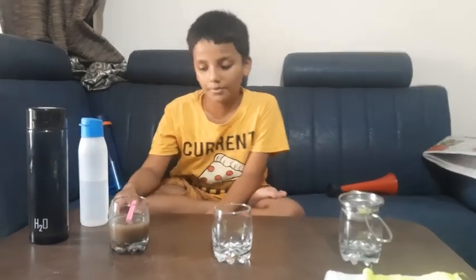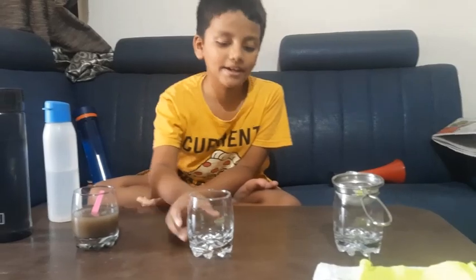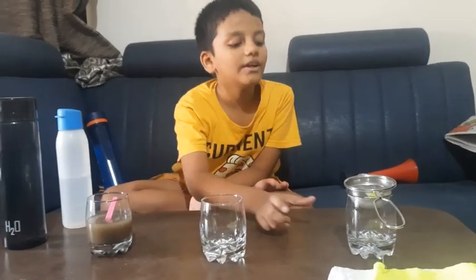Hi guys, my name is Anurag. Here we are doing sedimentation, decantation, and filtration.